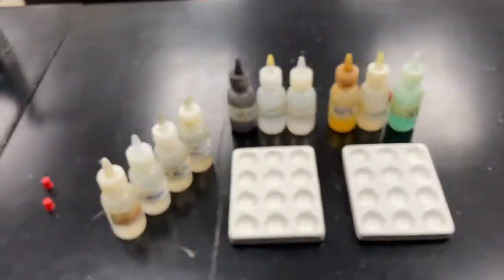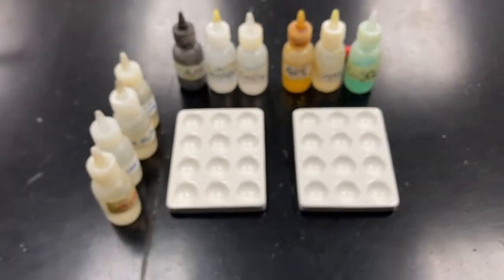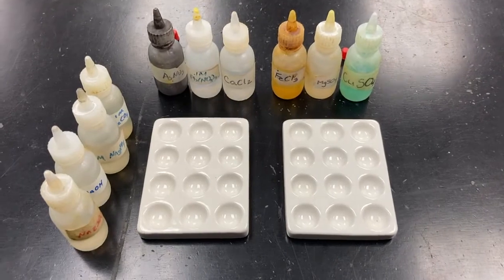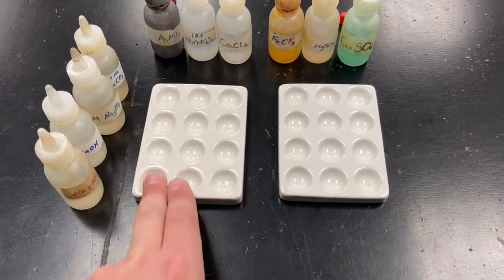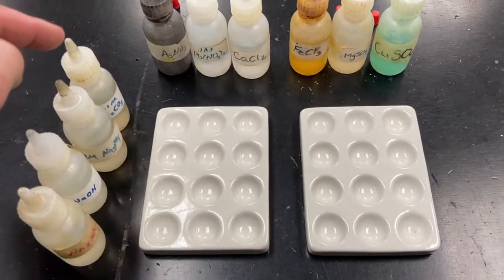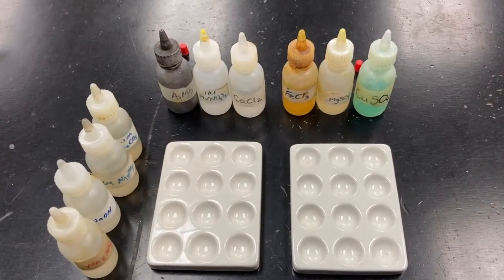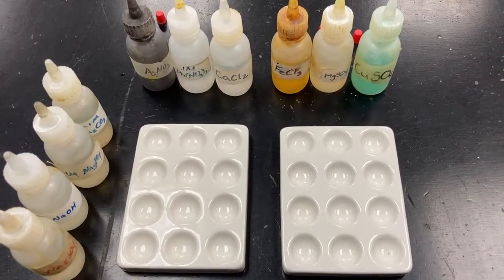Now, if you notice, they make a nice little 6x4 reaction matrix. And these are called well plates. And so I've got a well plate here, 2 of them side by side, matching up. And basically what we're going to do in this lab is mix every iteration of these chemicals together, okay? And then we're going to see if they produce a product.